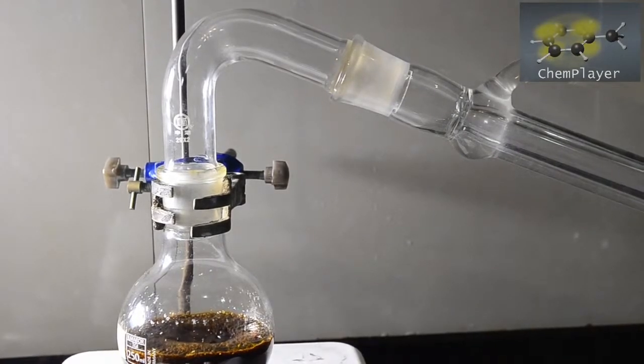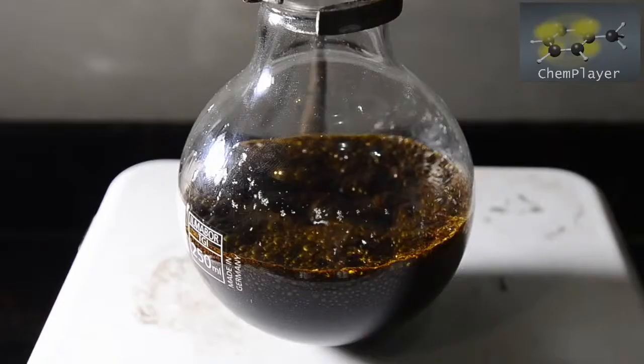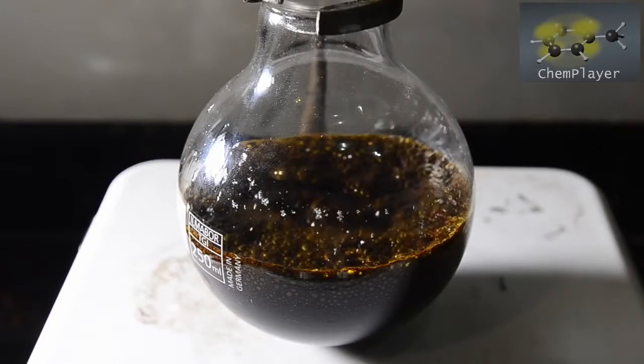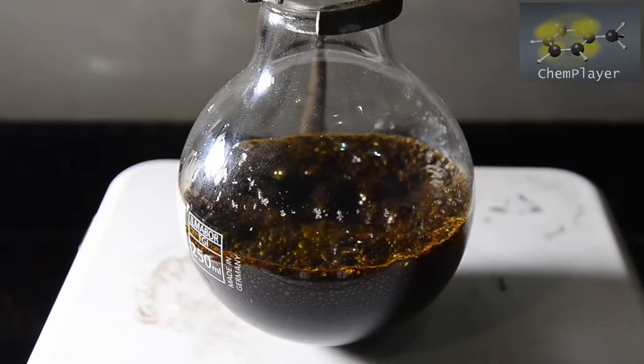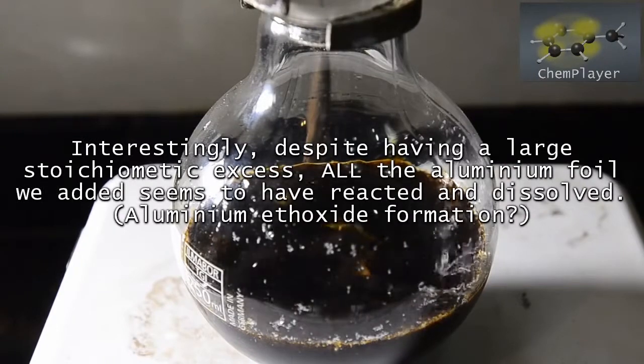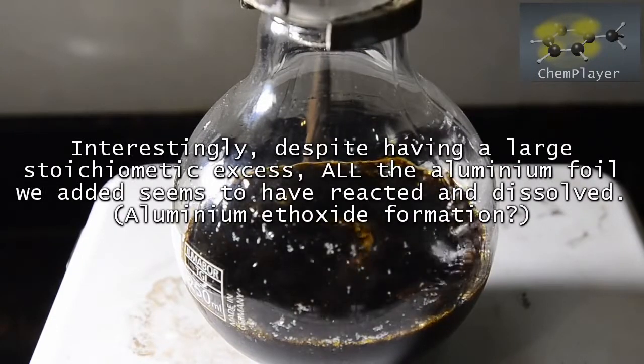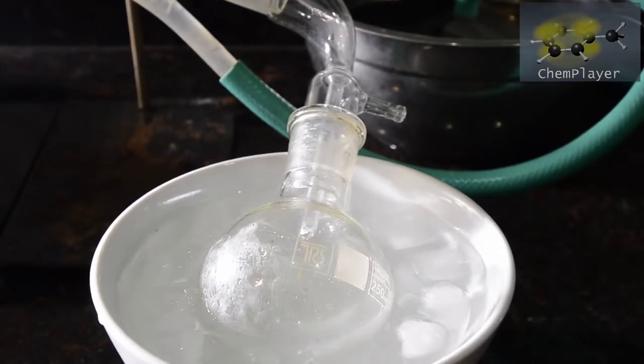We're going to distill all liquid, so we didn't bother using a thermometer. On heating, the foam soon dies down and we start to get a clear liquid distilling, which to begin with we're assuming is excess ethanol.